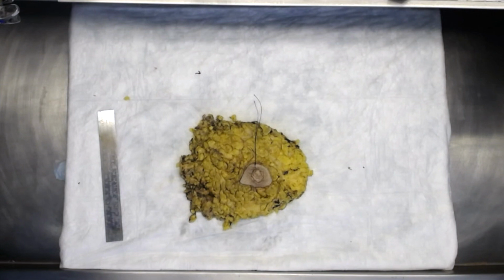Here we have a skin-sparing mastectomy specimen consisting of breast tissue, skin, and nipple. Note the laterality of the mastectomy, i.e. right versus left. Many specimens will show an axillary tail, which appears as an extension of fatty tissue at the lateral aspect of the specimen, which may be designated by the surgeon with a stitch. In this case, the axillary tail is not prominent, so we rely on the surgeon's designation of the specimen as right breast in this case.